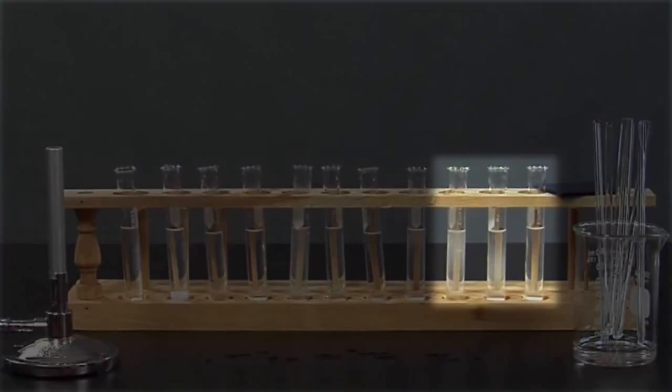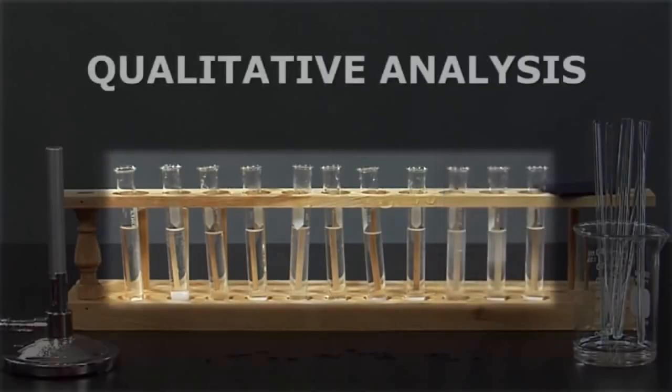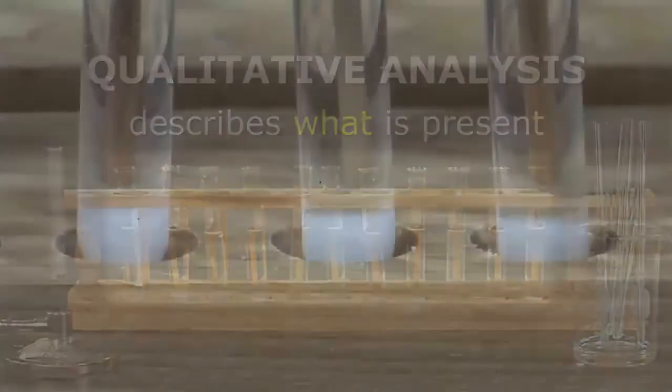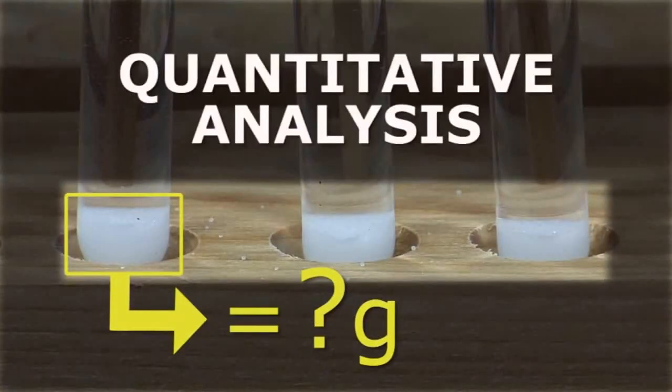In order to identify the metals present in these unknowns, we will perform the flame tests on the known substances. That will generate the data that we need to identify the unknown substances. What we are attempting to do is to conduct a qualitative analysis of the substances. By that, we mean we will try to identify which substances are present. If we were trying to figure out how much of the substance is present, we would conduct a quantitative analysis.